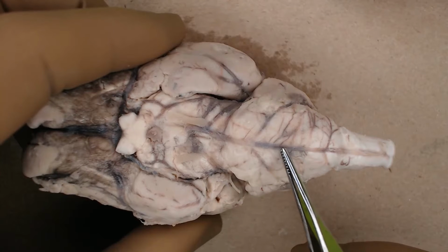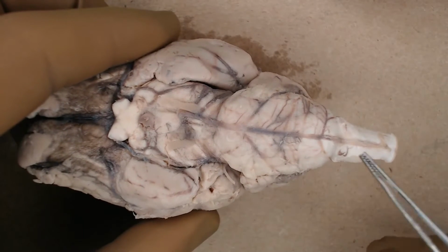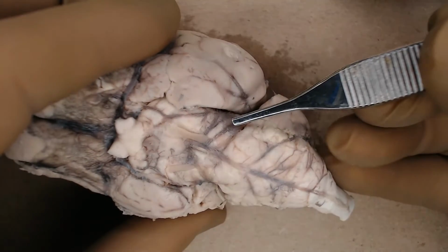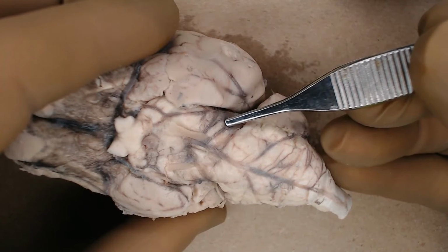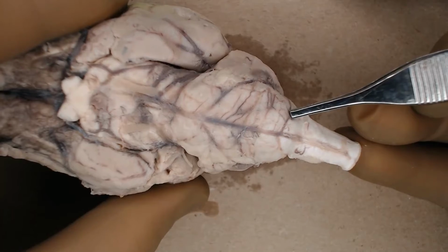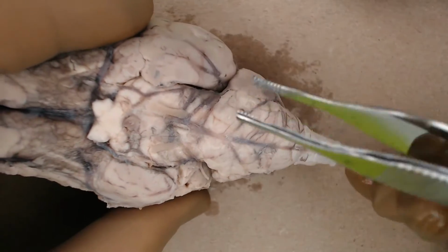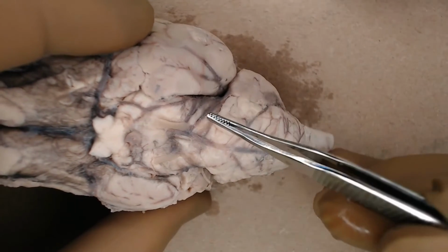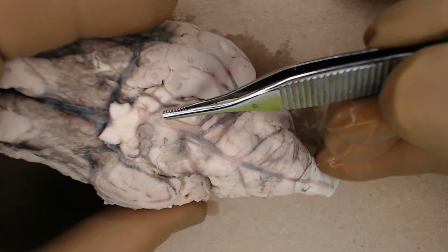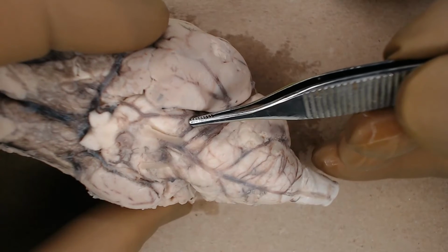And the sheep don't have an obvious incoming vertebral set of arteries, but you can still see where the main side branches are. So here are the superior cerebellar arteries, anterior inferior cerebellar, and posterior inferior cerebellar. So that would make this region the basilar. And I know that this is the superior cerebellar because the oculomotor nerve, if you still have yours intact, divides this superior cerebellar from the posterior cerebral artery.